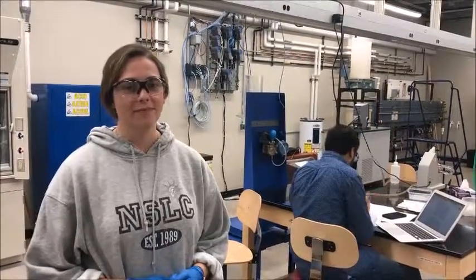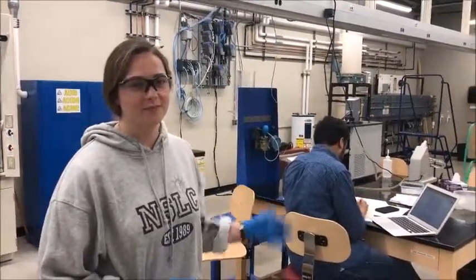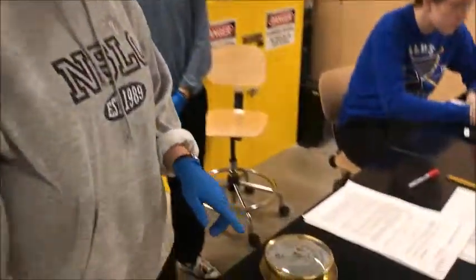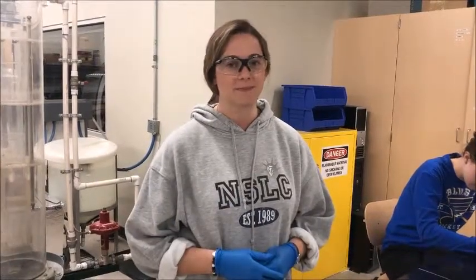Before starting the lab, make sure that a TA is present. The first thing to do when starting the lab is measuring the atmospheric pressure using the barometer. You will also take a pressure measurement at the end of the lab to make sure that there is no dramatic pressure increase or decrease during the duration of your experiment.